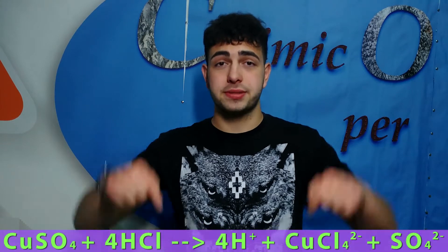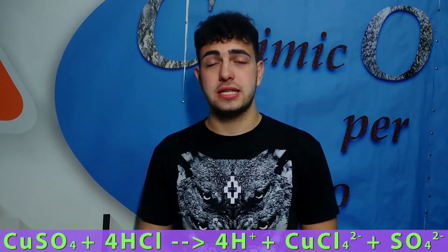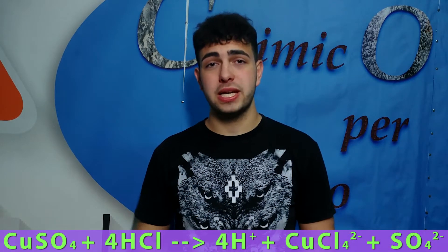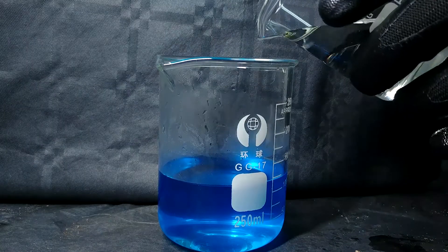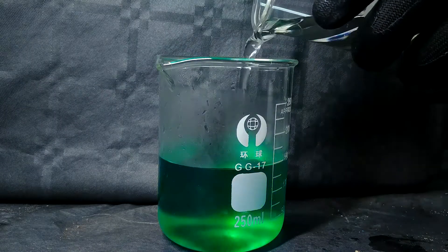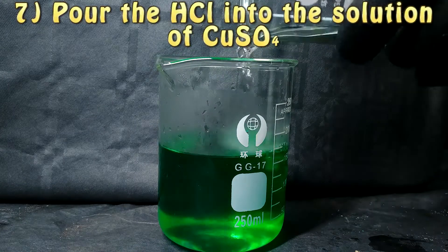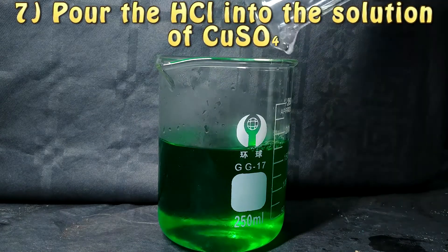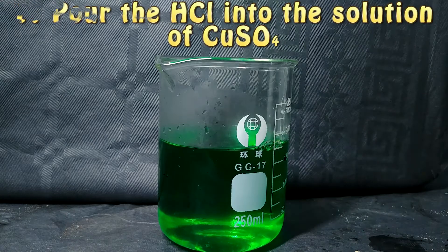By mixing these two solutions, this reaction happens. As you can see, a complex is formed with copper and chloride, and this complex is important because it is our source of copper chloride. This reaction is really important to continue our experiment.